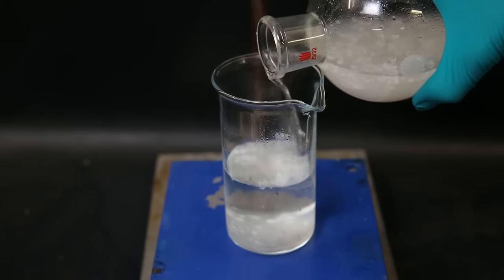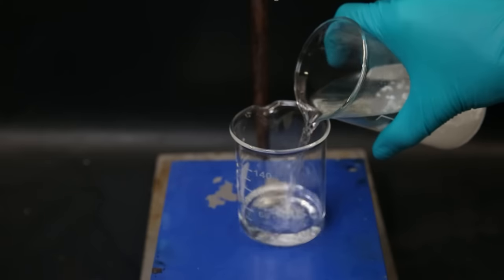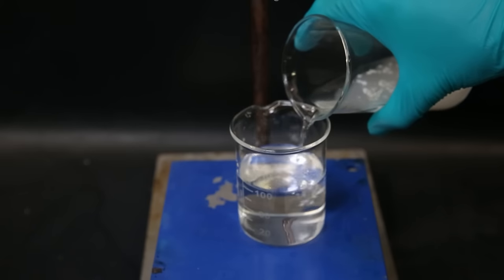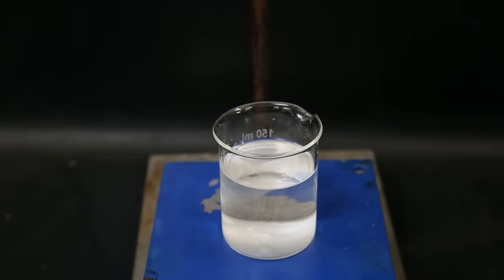Still, a lot of the water layer has come with it, so I decant the ether layer carefully into another beaker. I then dry the ether with some sodium sulfate.